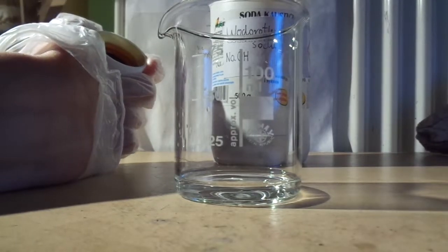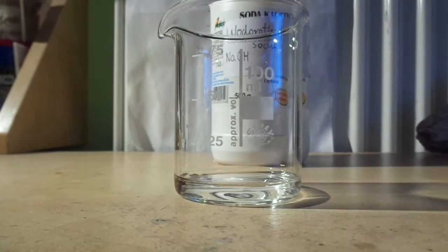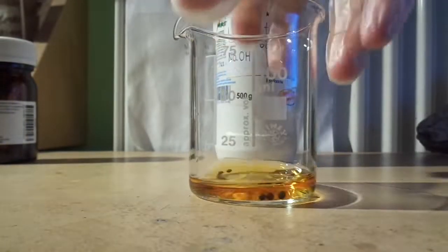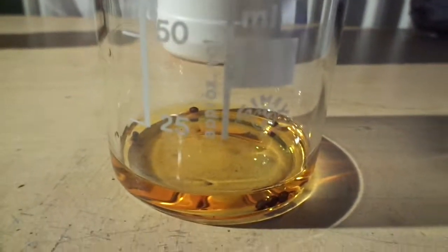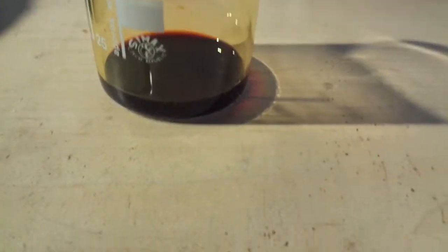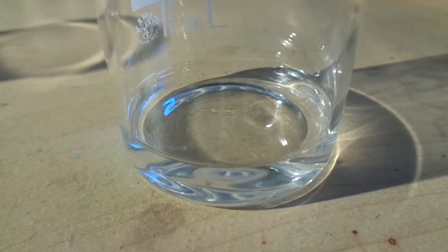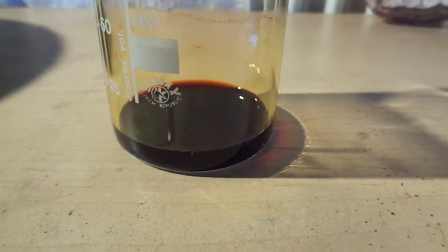I'll add a couple bits of iodine, so that's going to take a while to dissolve. Now I have the iodine tincture solution ready, and here I have a solution of 10% sodium hydroxide. I'm going to mix those two ingredients.